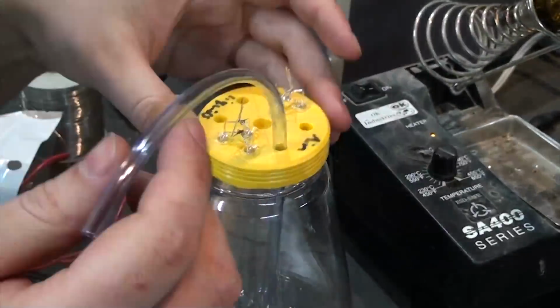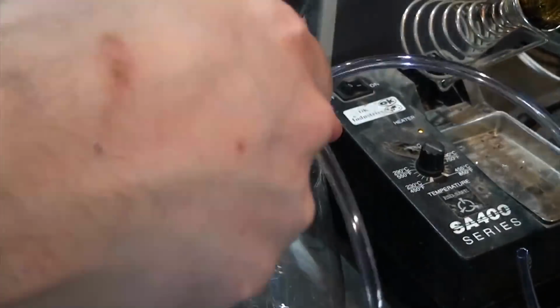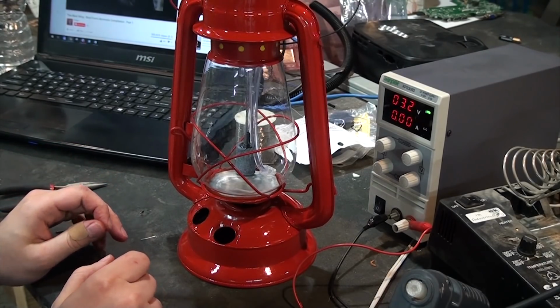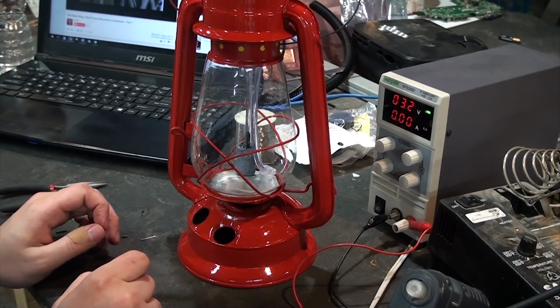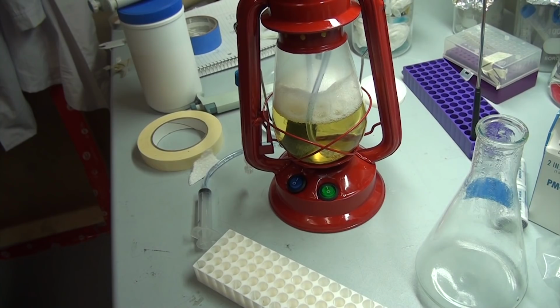Since this would be awkward to work with once it was mounted in the lantern, I mounted all the tubing and LEDs, as well as wiring them all up. After trimming the tubing to length, I also added an air stone to the air intake and a luer lock connector to act as a weight for the fluid removal line so that it sits at the bottom of the container.